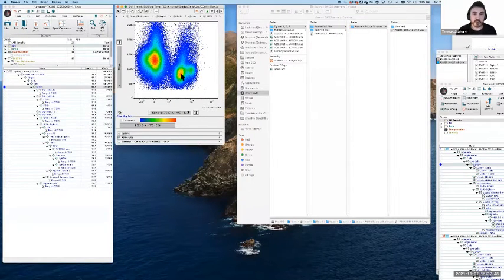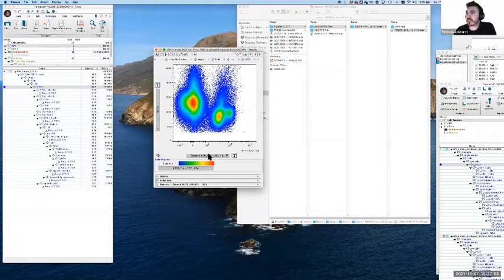There is one, actually two last things, in fact, that I wanted to quickly show, which are both good for discussion, but also an important jumping point into further work, not what we're going to tackle today. Sometimes we get situations where we find evidence of, let's say, overcompensation, but it's actually not what it appears. So in this example, this is APC on the x-axis and forward scatter on the y, and there is a super negative here of sorts.